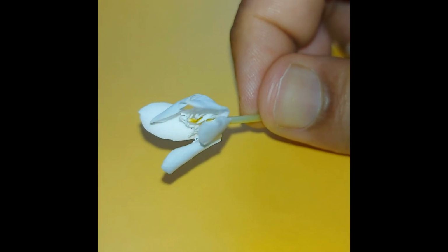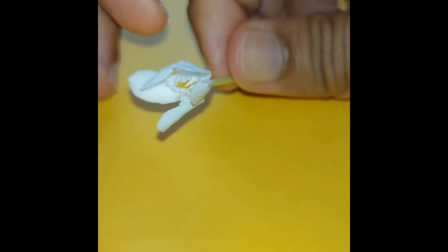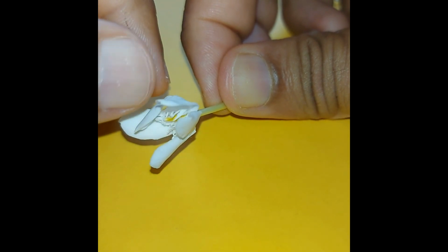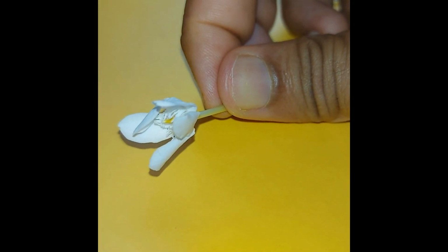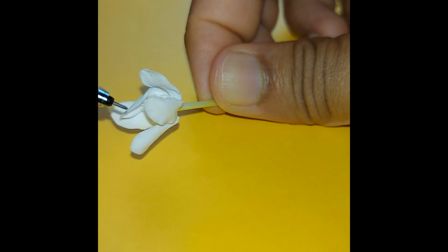Okay, based on the notes we discussed just now, the revision: this is a flower, and you will need to identify what kind of pollination it does based on the questions I'll be giving you later. So the components of the flower, as I said, in the revision portion, this will be the petals. Okay, this will be the petals.